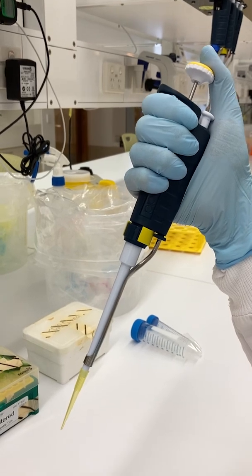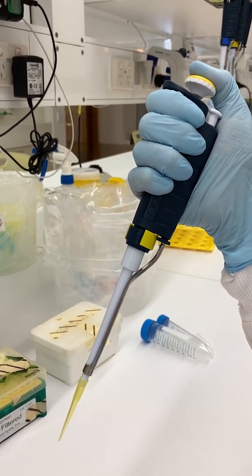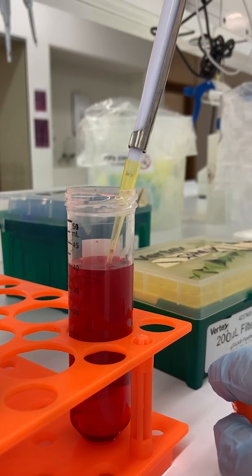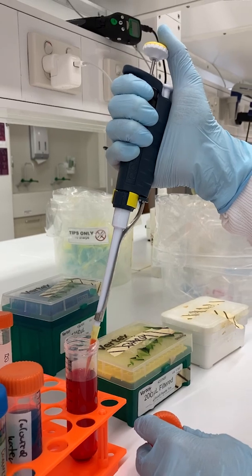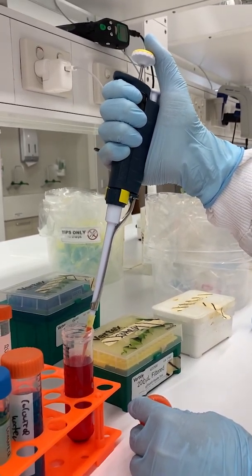It works like this. Press the plunger down to the first stop. This pushes air out of the barrel of the pipette. Next, keeping your thumb down, insert the pipette tip into the liquid you wish to draw up, just below the surface. Now slowly release the plunger so that you draw up the liquid into the pipette tip.